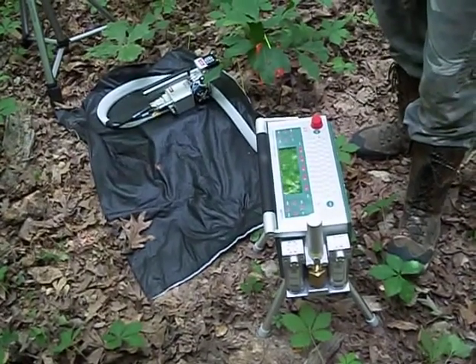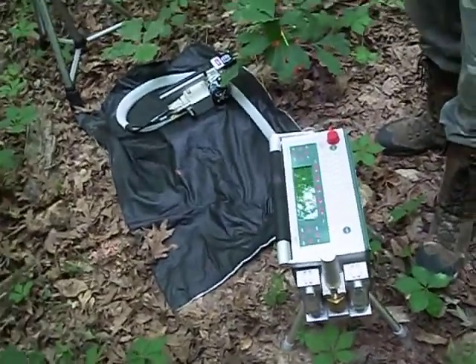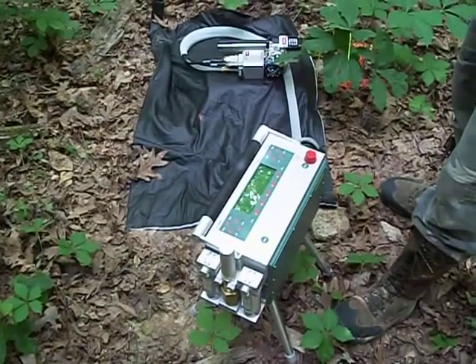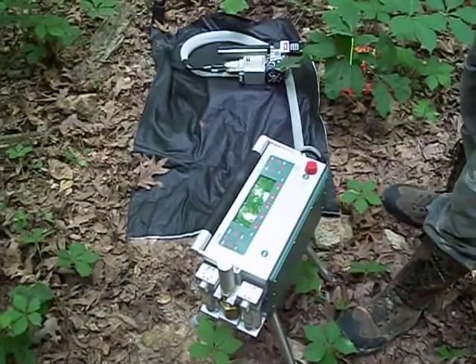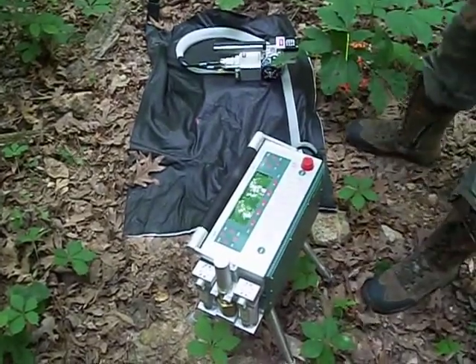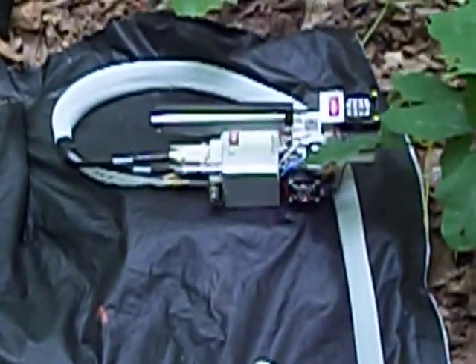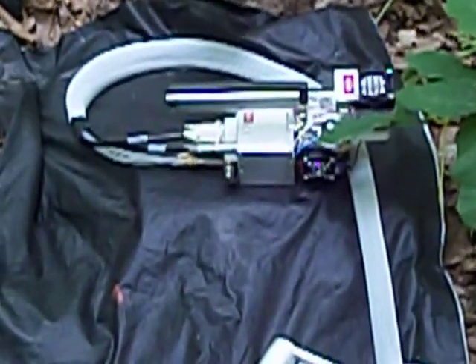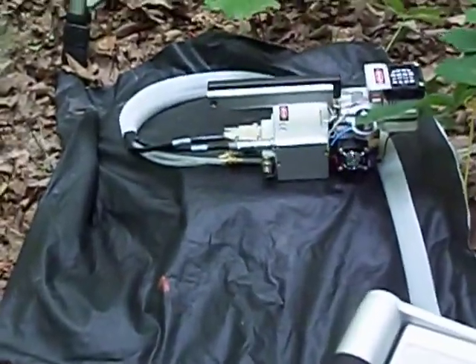We can measure things like conductance of the stomata, which will allow the gas to enter the leaf. We can measure vapor pressure deficits, all those types of things that tell you about how much moisture is in the leaf. Also, this Ghostbuster looking unit here collects data on the amount of light inside the chamber, the temperature, the relative humidity, and uses all of those to calculate how much uptake the leaf is conducting.